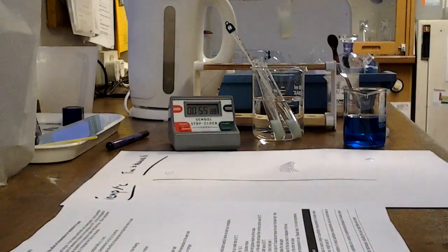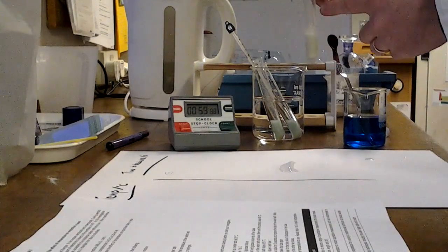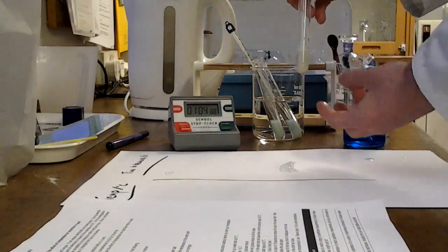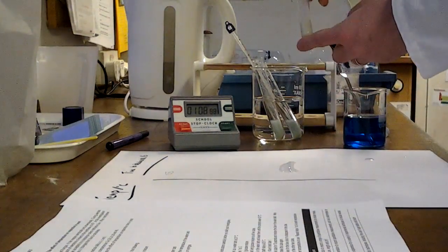You might do that in the hope that that kind of speeds up the reaction. But all you're doing there is you're stirring the oxygenated layer back through. You're actually giving oxygen to the rest of the methylene blue in there, and you might actually turn it blue again. So you should leave it still for the whole thing.